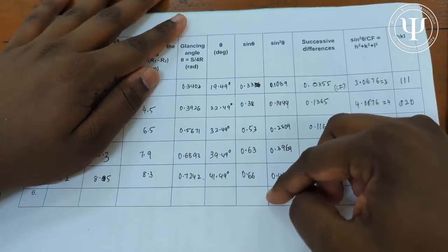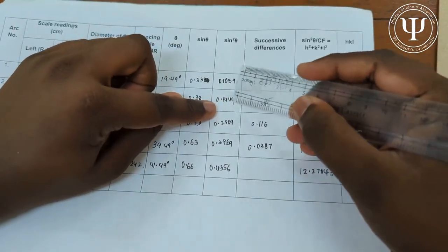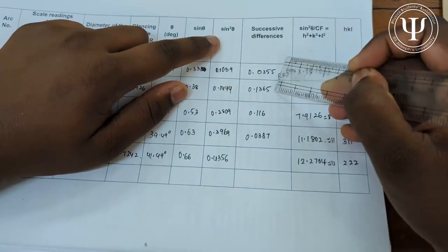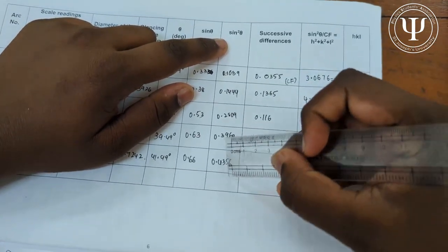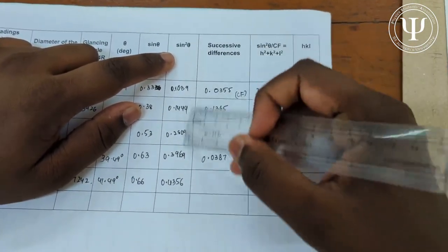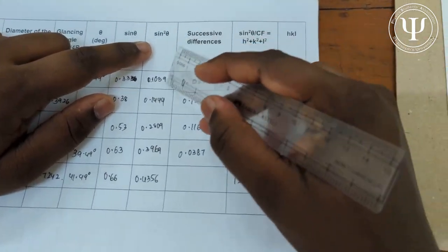Take the sine of each degree value, then square them to obtain sin²θ for all five readings. Next, calculate the successive differences: value 2 minus value 1, value 3 minus value 2, value 4 minus value 3, and value 5 minus value 4, giving four successive difference values.